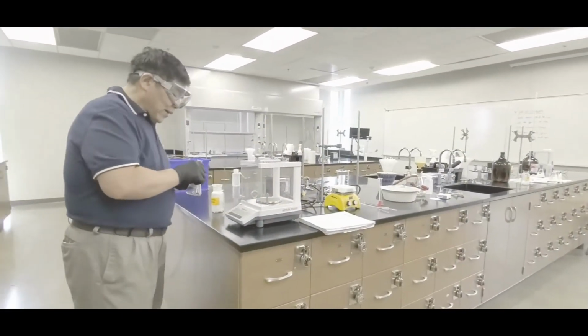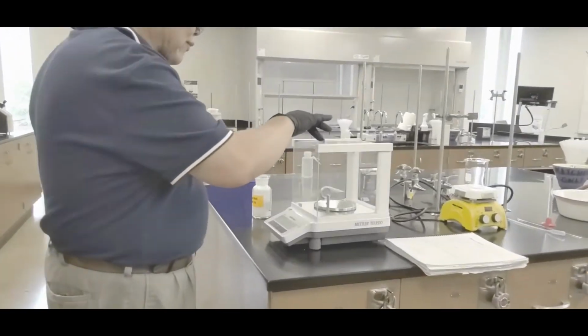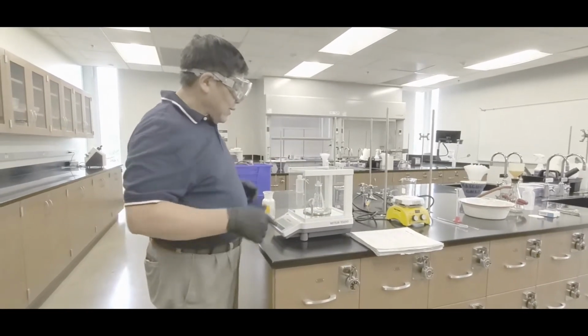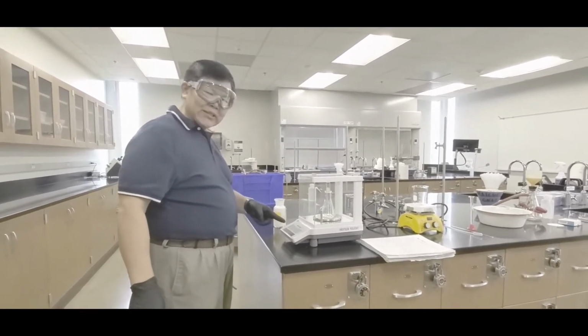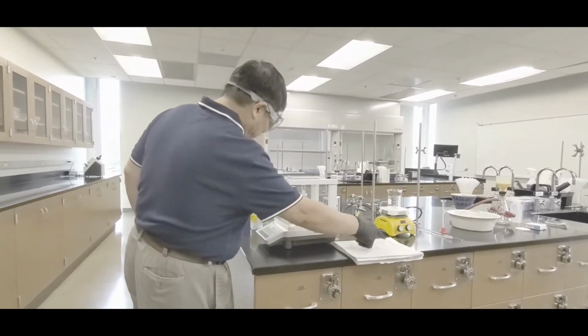Go to the analytical balance. Make sure you zero that. And then what we do is I'm going to go to the top. It might be coming in this time like that. So in that case, park it in like that. And the test tube should be below the window, so you'll be fine. Okay, so therefore close the window and then record this particular mass, okay? That would be your mass of flask and empty test tube, okay?